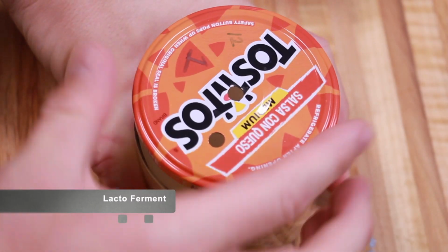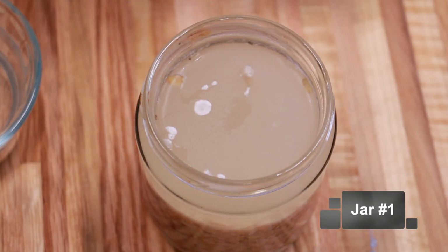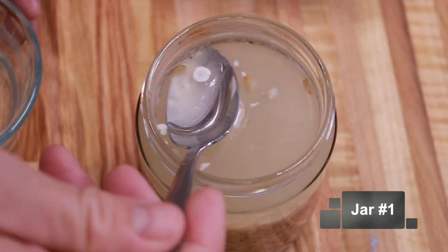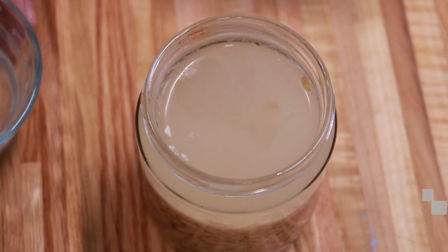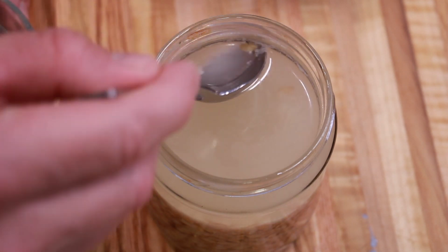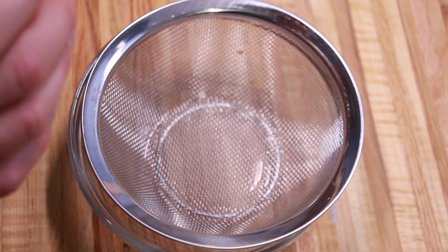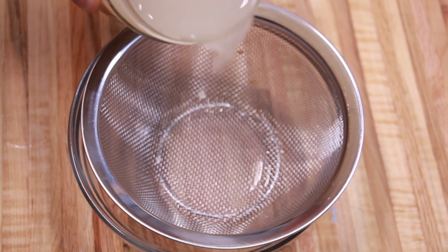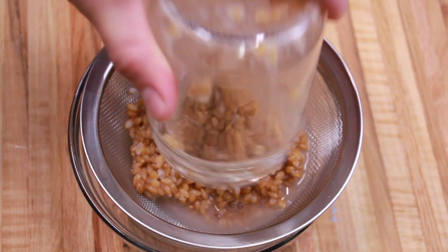Moving over to the lacto ferment jars, this here is jar number 1, and it's fermented for 10 days at this point. You can see there's no injection port installed, there's no tape put over the hole for the vent. I'm trying to just leave it open so that any bacteria and fungi, spores, or anything that's in the atmosphere can get through those holes and help establish that lacto ferment environment that we're looking to get here.